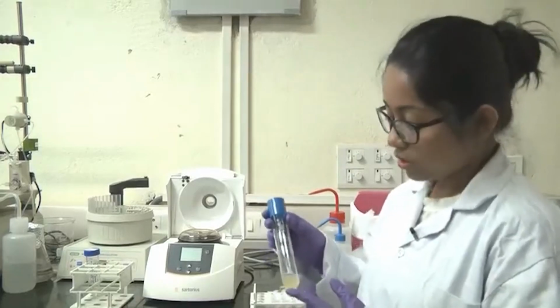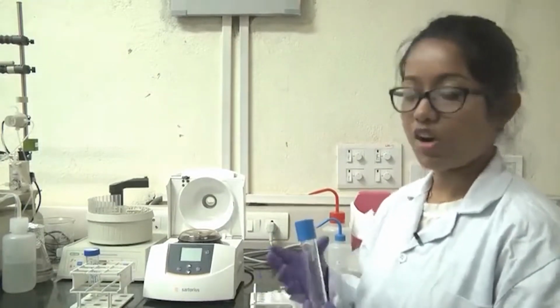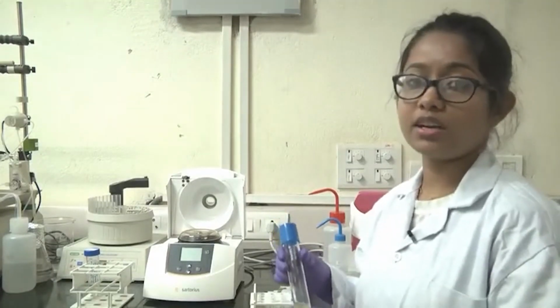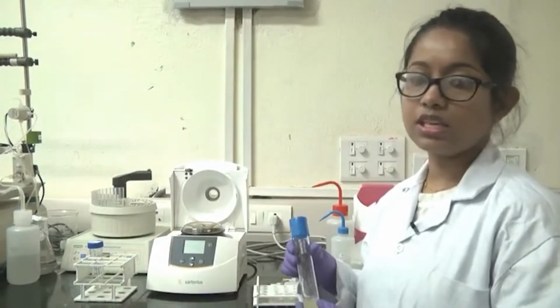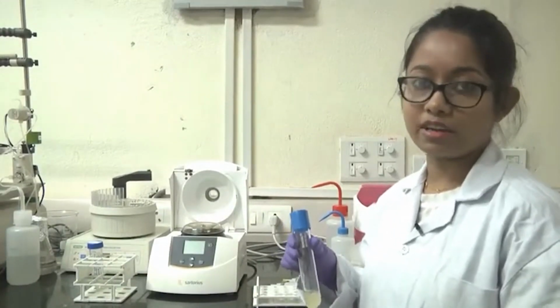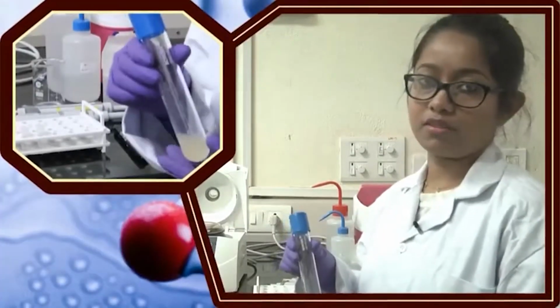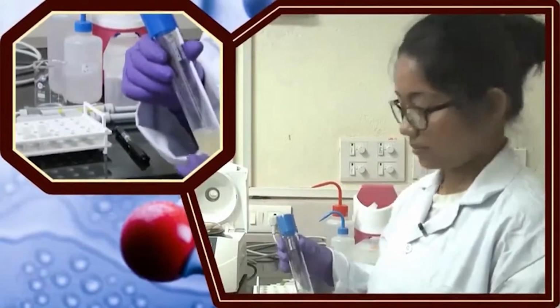As I was mentioning, the culture tube should not be filled too much. Whenever you are growing bacteria, suppose you are taking any kind of conical flask or a tube like this, you should not fill that particular container more than 1/3. So, suppose you want to make 250 ml of culture, you should not take a 250 ml or 500 ml conical flask. You should take at least a 1 liter conical flask where it can grow properly. Otherwise, the aeration will be hampered and the bacterial growth will be less.